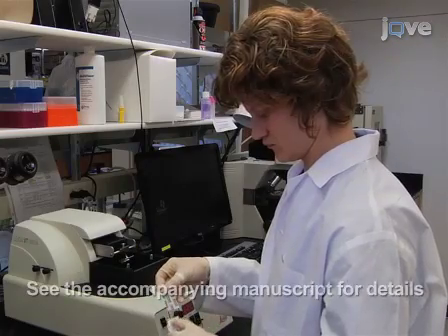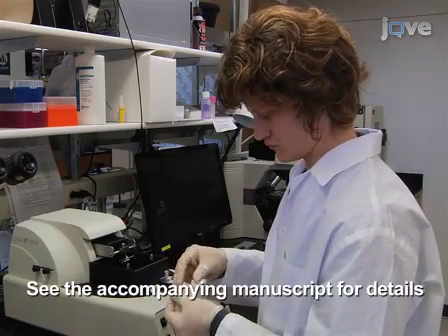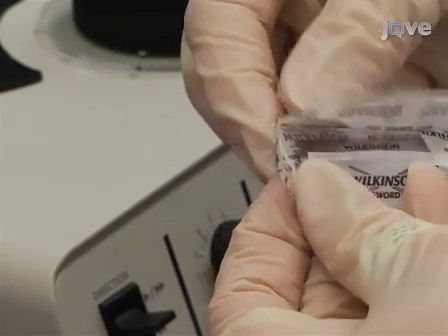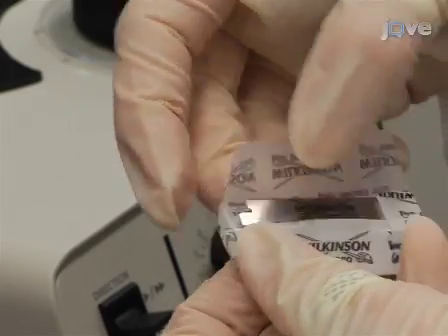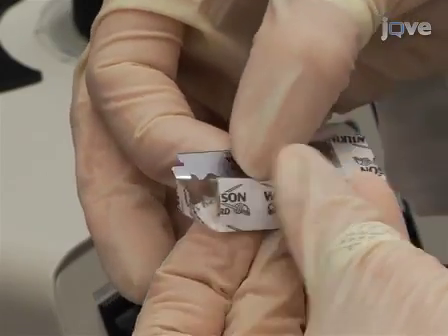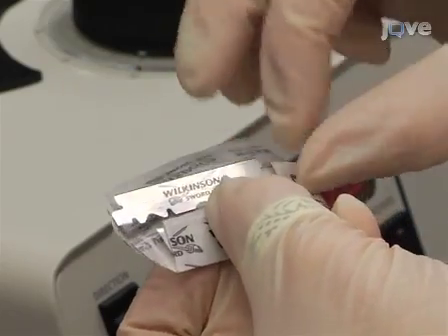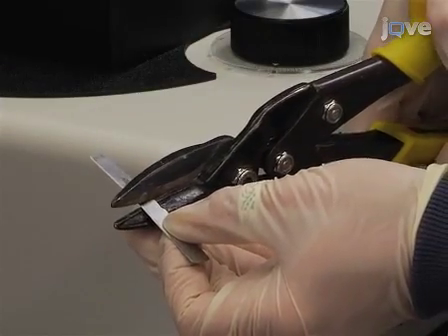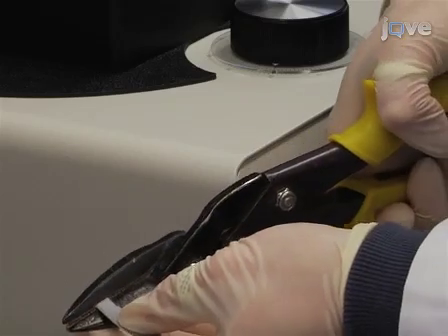Prior to slicing the tissue, prepare a customized Wilkinson blade by rinsing with solvents followed by water. Separate the double blade lengthwise into two single blades. Next, support the Wilkinson blade with a microtome blade.